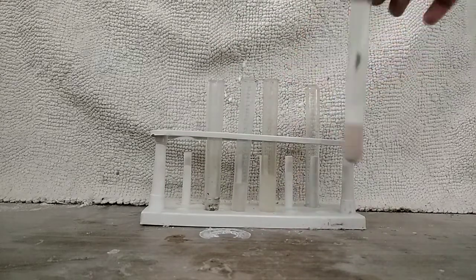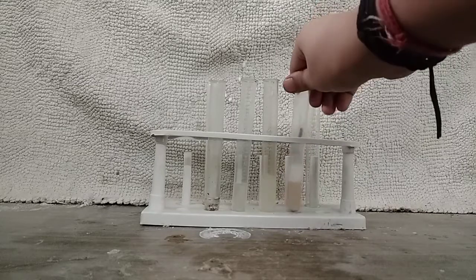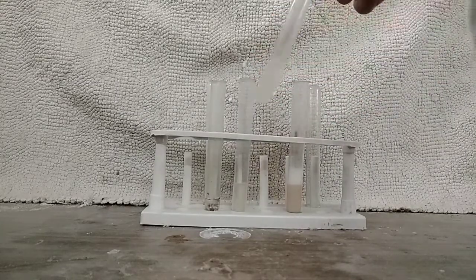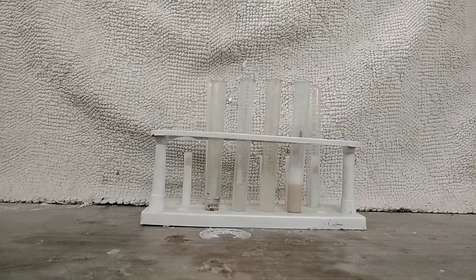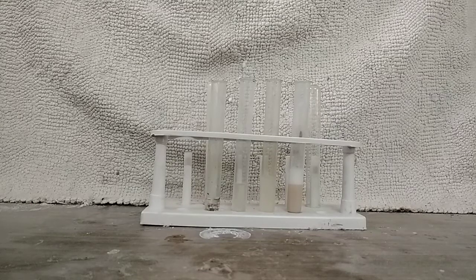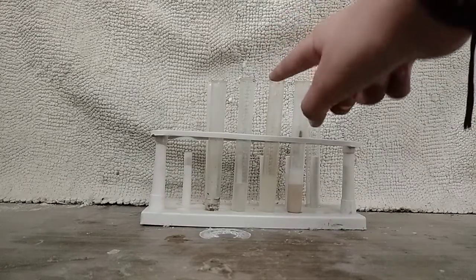You need some of your fluoride solution — I am using the toothpaste solution which I will be testing today. Then you will require some sodium carbonate, which you can easily create by heating baking soda, which is sodium bicarbonate, or it can be purchased by the name of soda ash.